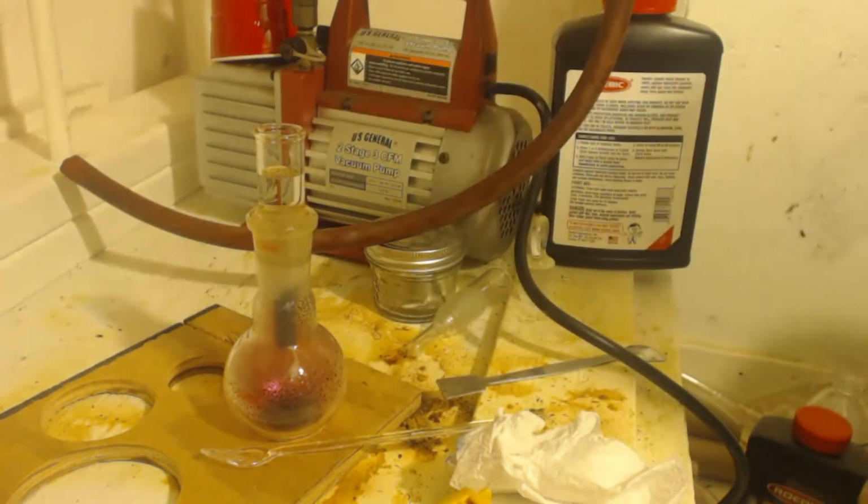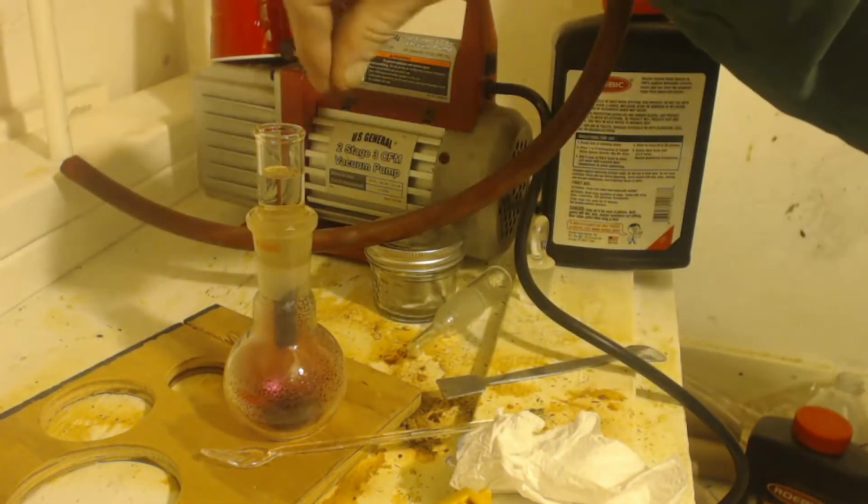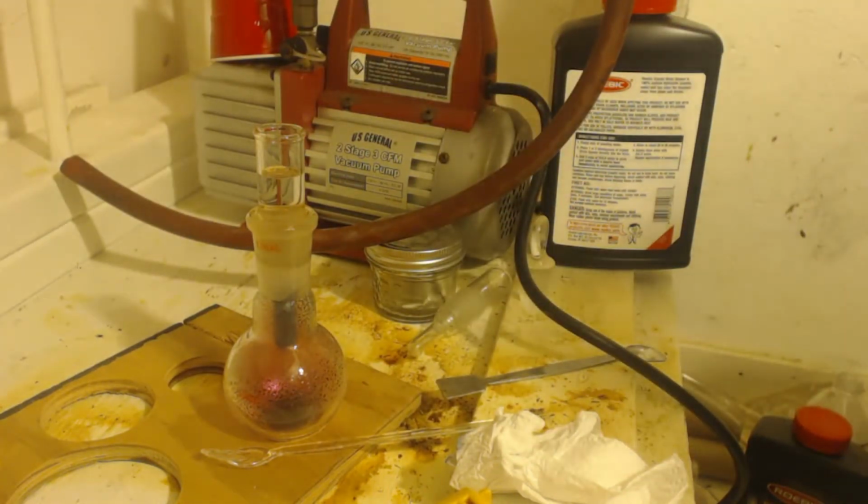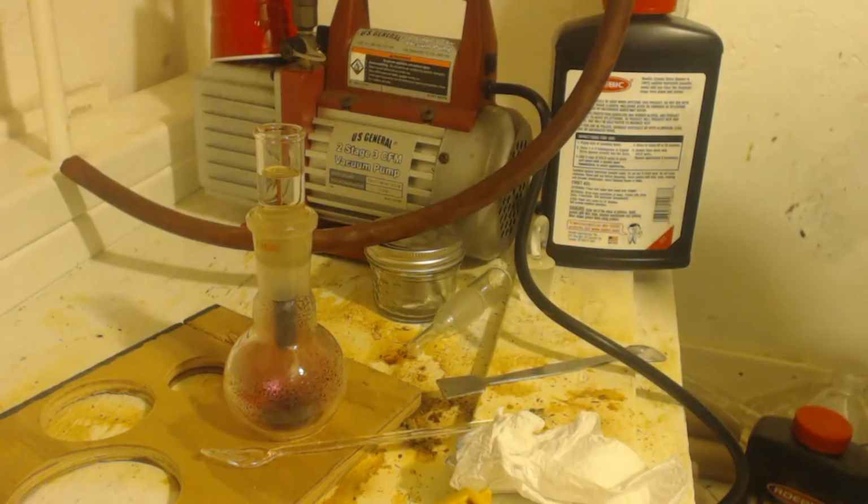Cool down. I'll get the water. Don't spill the water out. Get a pipette. You can spill it now. This is going to spill out. You know what I mean? So I just wanted to show that. So we've got a Grignard coming up. Make some propionic acid. Now you can see those crystals. Anyways, you all have a great day, and always remember science is great.